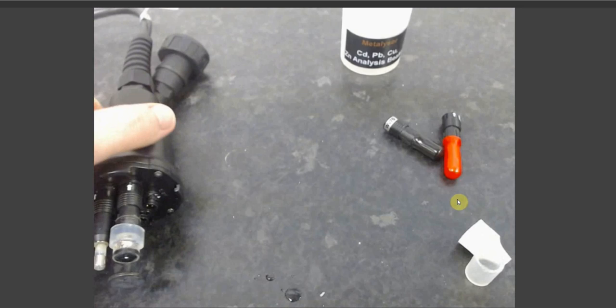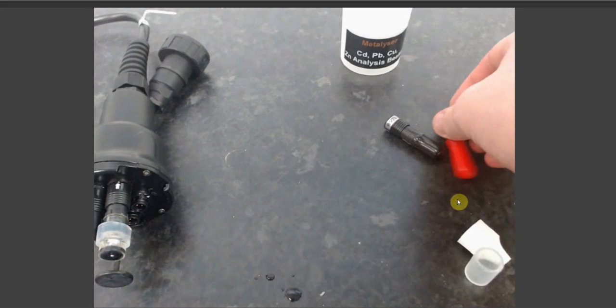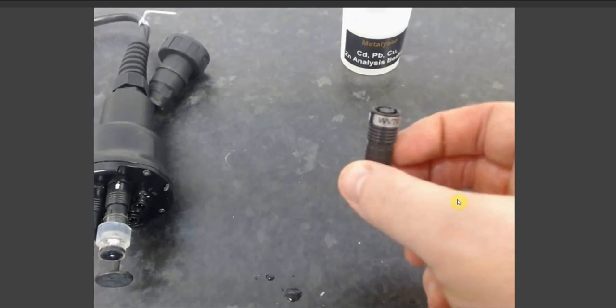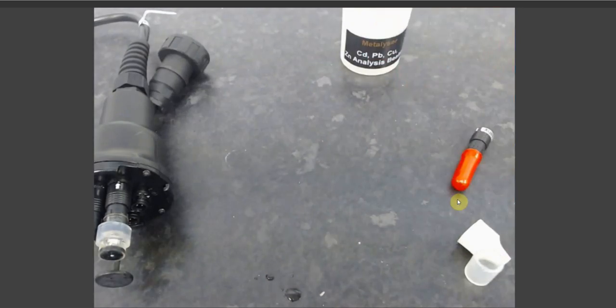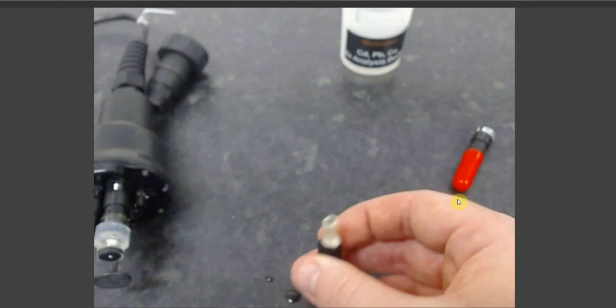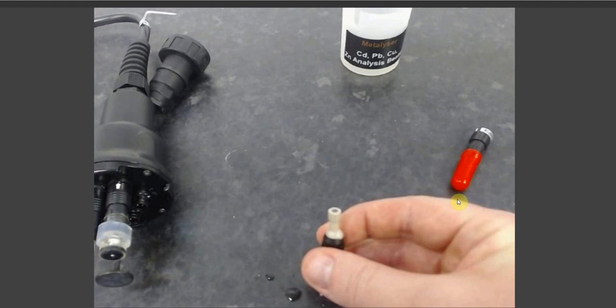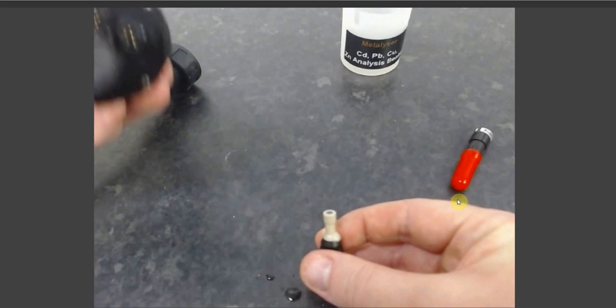Once that's done, you can move on to your working electrode. Your working electrode should be selected dependent on which test you are doing. You will find which electrode will be required within the application note of your test. For now, I shall use your WE1 as an example. Before use, the electrode should be polished. However, we will be covering the polishing of electrodes elsewhere. Since we will be skipping that step for the moment, I'll simply show you.